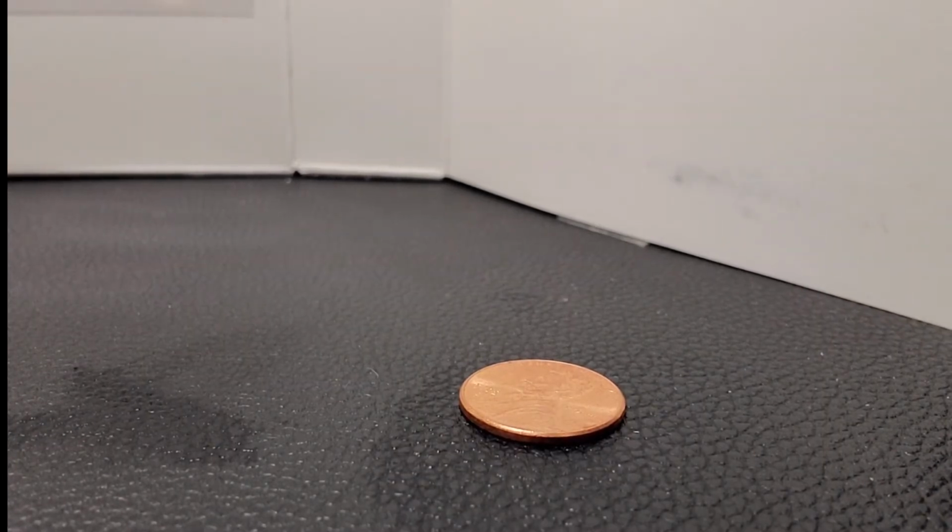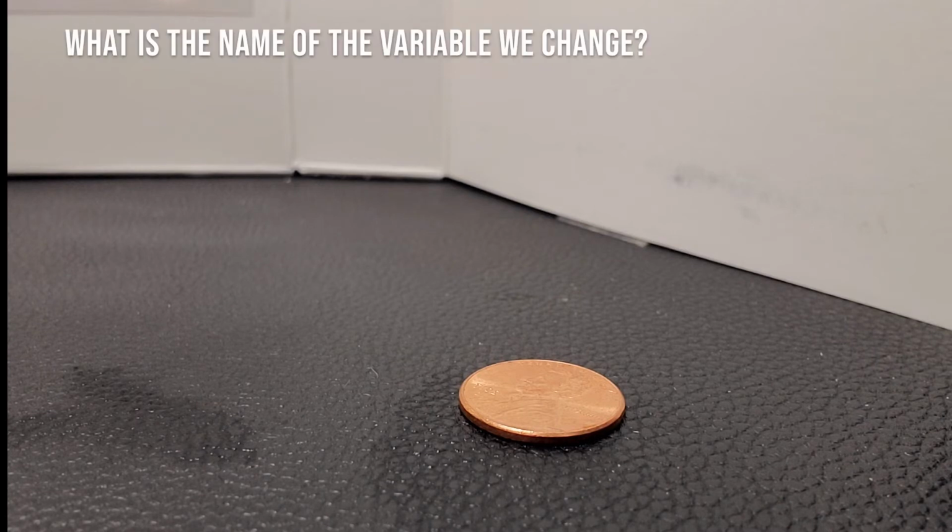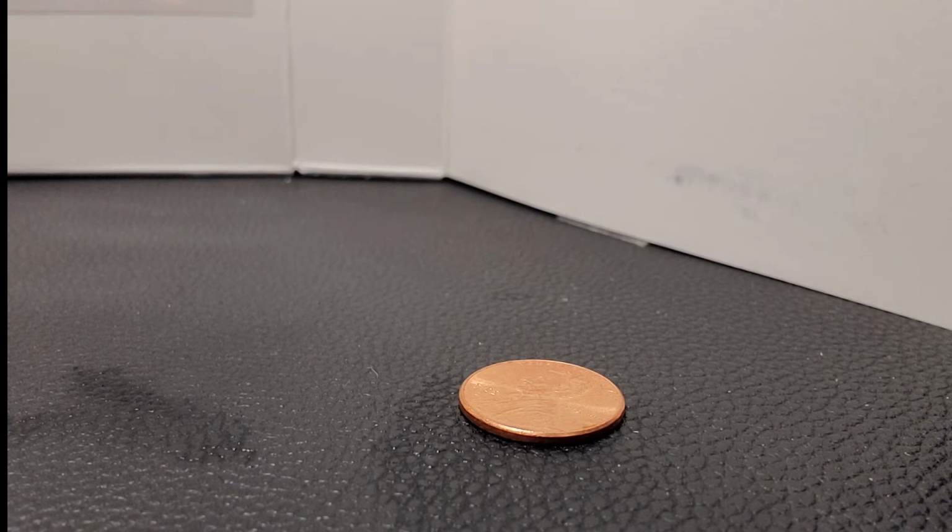All right, so I've cleaned up the water. Next thing I would like to do, I want to change one variable in our experiment here. And so I'm going to see if I can change the properties of adhesion by applying soap to the surface of the penny.